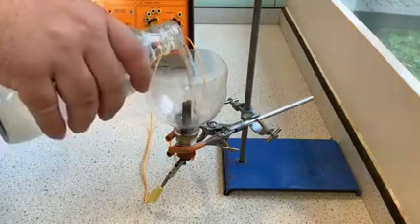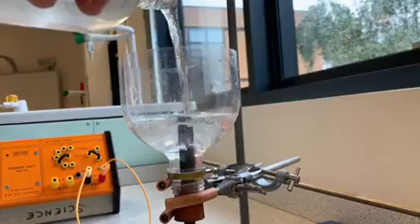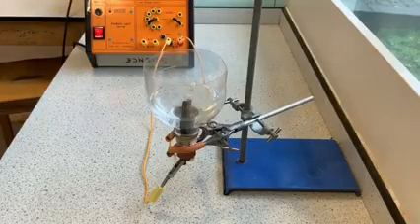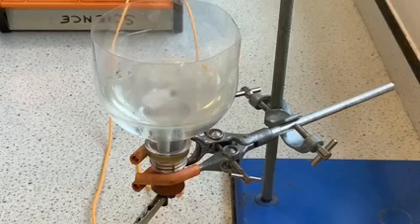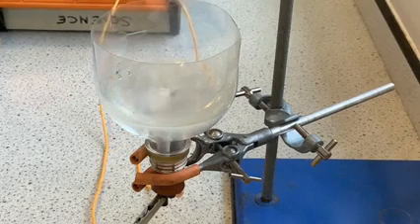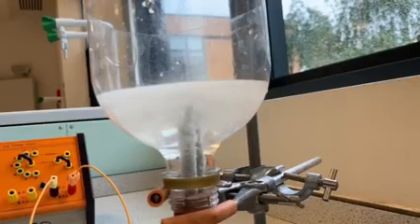So I have some sodium chloride, which is just salty water, and I put it into this little piece of apparatus over here, which is going to pull the chlorines to one of the electrodes. So as I turn on my power pack, what we should see is some bubbling, and that is chlorine gas being produced. And normally you do this in a fume cupboard. So we've got chlorine gas being produced.